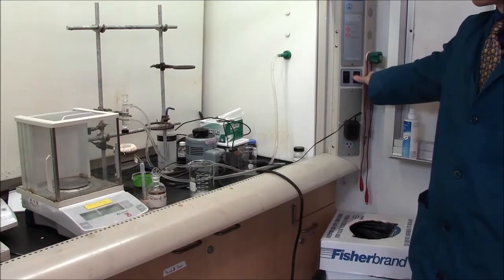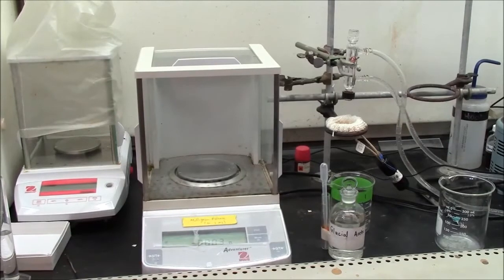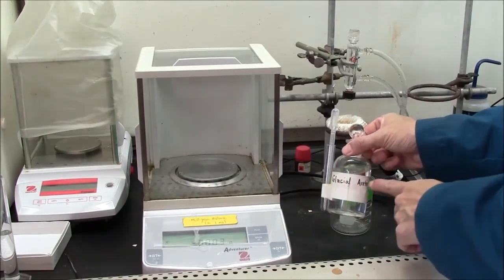You'll want to use the fan today when you're weighing out glacial acetic acid. If your buffer requires you to weigh out glacial acetic acid, it must be kept in the fume hood.